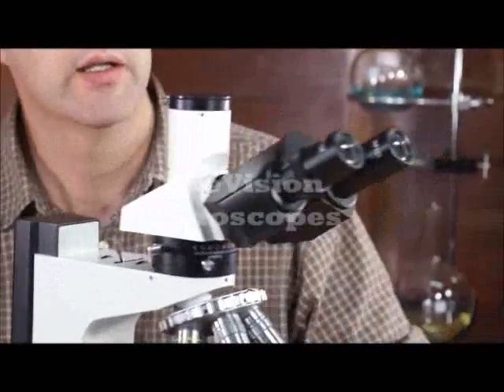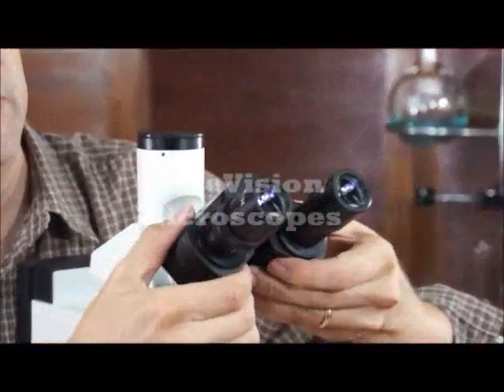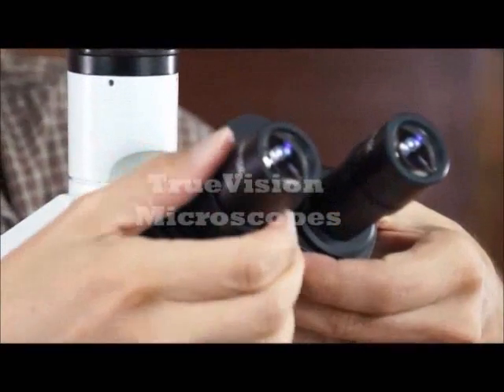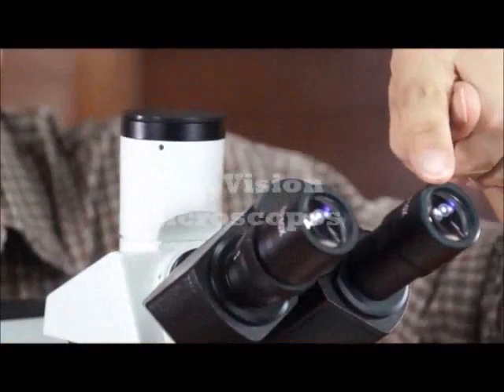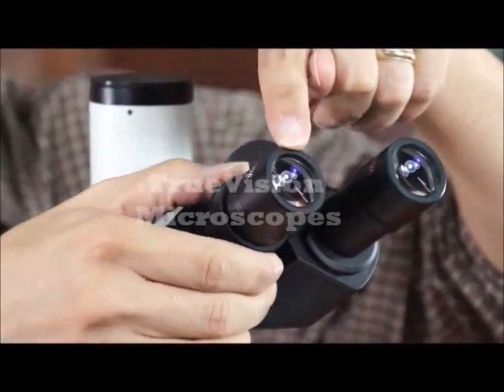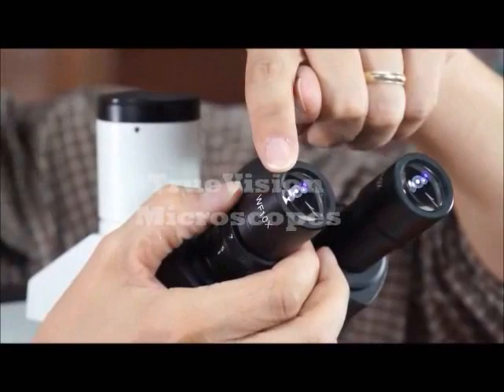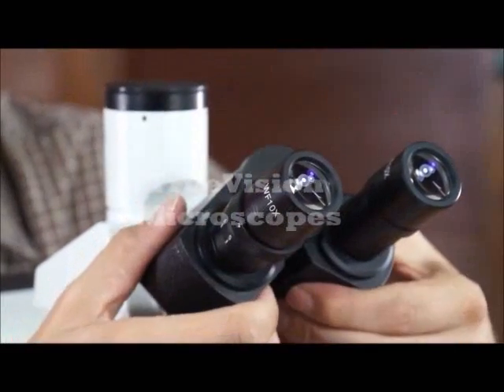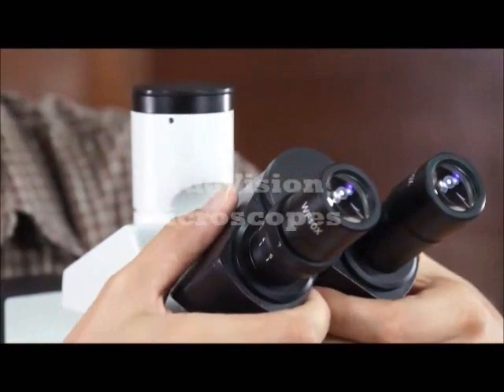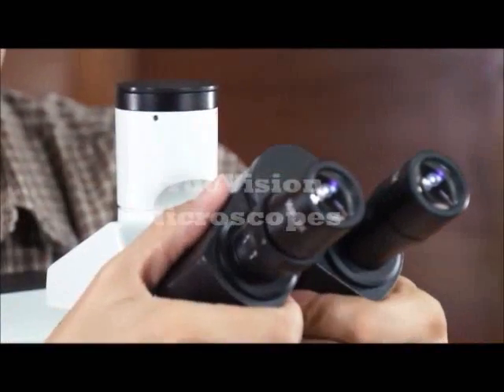Looking at the eyepieces, they're wide field 10X eyepieces with a diopter adjustment on one. The diopter adjustment is used so that you get one eye in focus, and if the other eye is not in focus, you adjust the diopter slightly so that both eyes are in focus. This is the interpupillary distance — you adjust that so that the distance between your eyes matches the eyepieces.